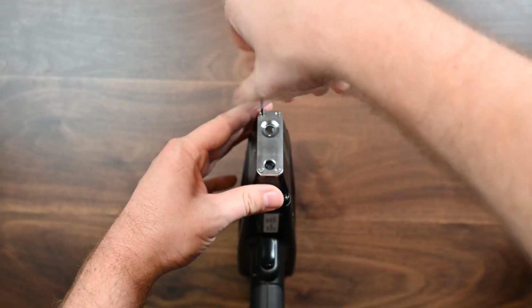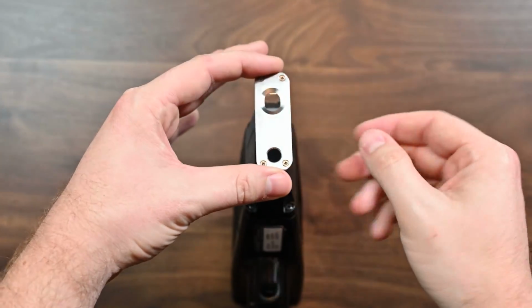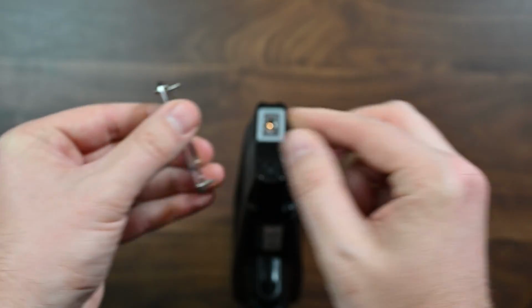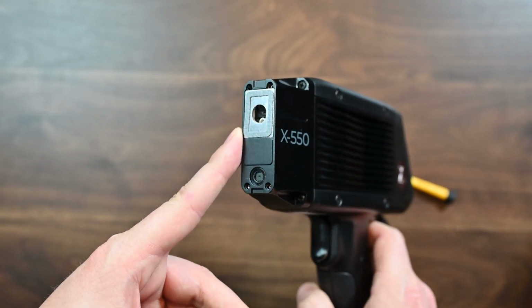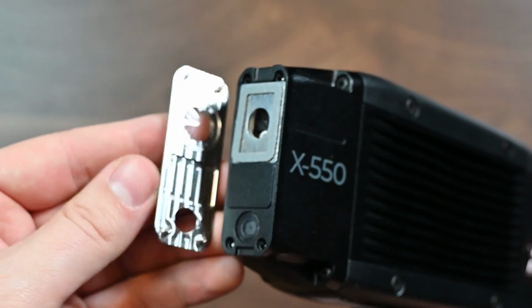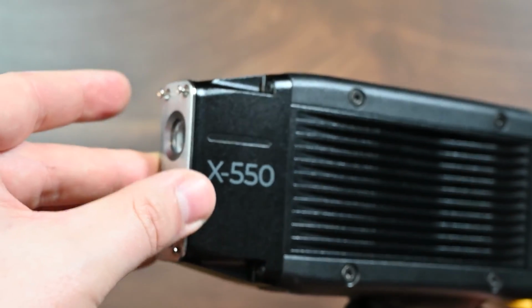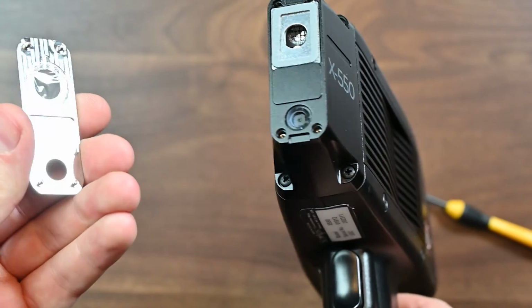So let's undo these screws here. Okay, there you go. I'll show you here. So now these screws, they don't come out of here. They're still stuck in there, which means you're not going to drop them or lose them. Now, this leaves your analyzer pretty exposed, and you can see the interior there. One of the nice things that SciAps did is there's a nice little embossed rectangle, you can see it here, and that matches up right here. So you can see that the window part is on the top, the camera part down below here lines with the bottom, but even just gently fitting this together, I'm pulling on this thing pretty hard, it's not going to want to move. So that's how it's going to go back together, but let's get that window changed.